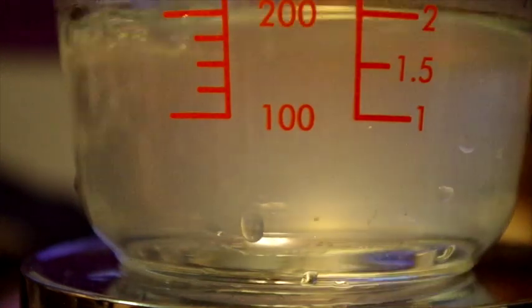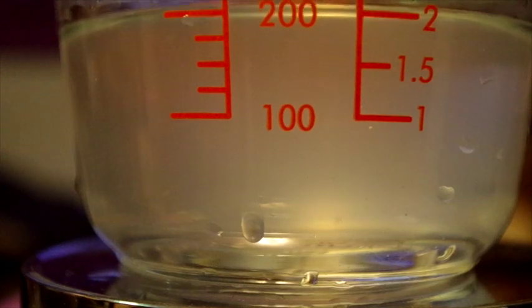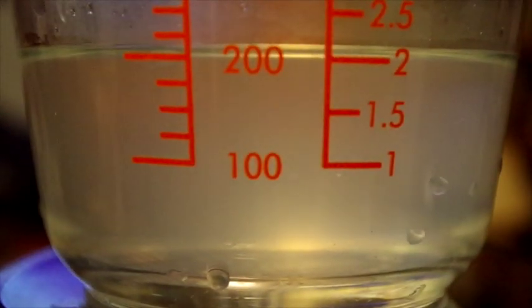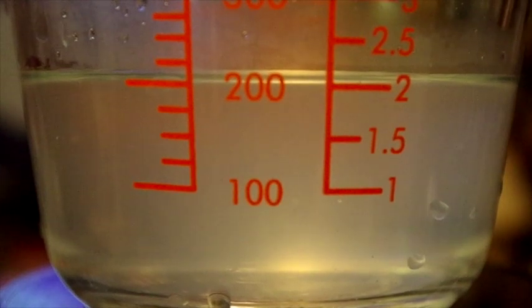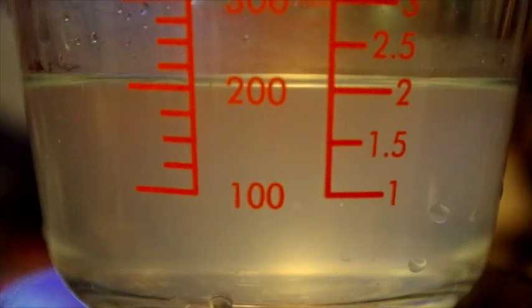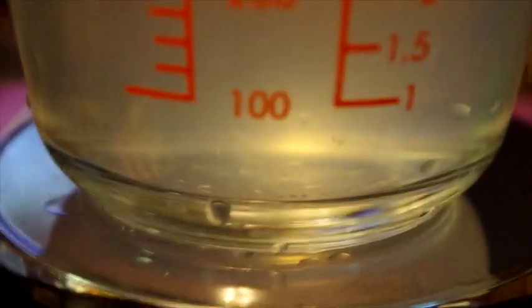So in this case, the mass of the beaker is still 658 grams, but now the mass of the new liquid is 876 grams and 200 milliliters. So you can see already that it's less volume, but the mass is higher than you'd expect, and so the density is going to be larger. But I will let you do that calculation on your own.